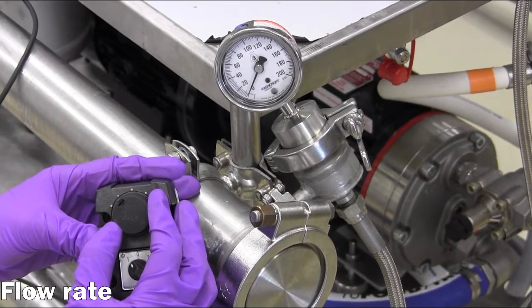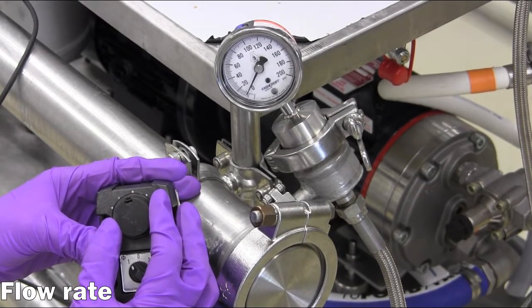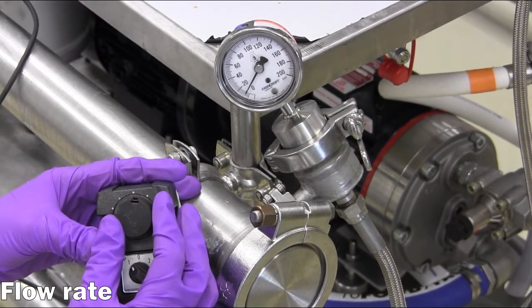A knob may be used to increase or decrease the pump speed, corresponding to the feed flow rate and inlet pressure.